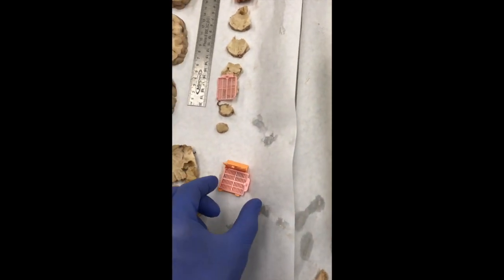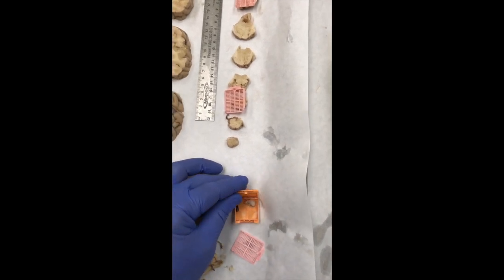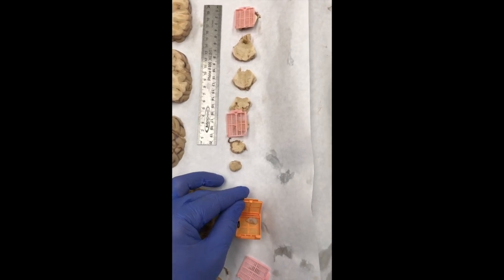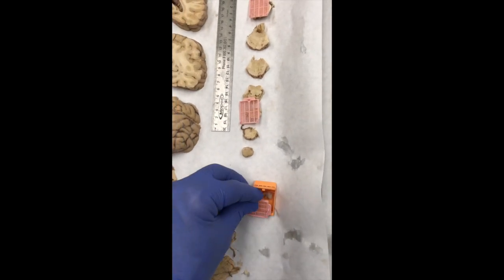And so I will also include in J a piece of the pituitary, which has been kept by the PA after removing it from the sella turcica, placing it in a cassette for later embedding and then microscopic analysis.